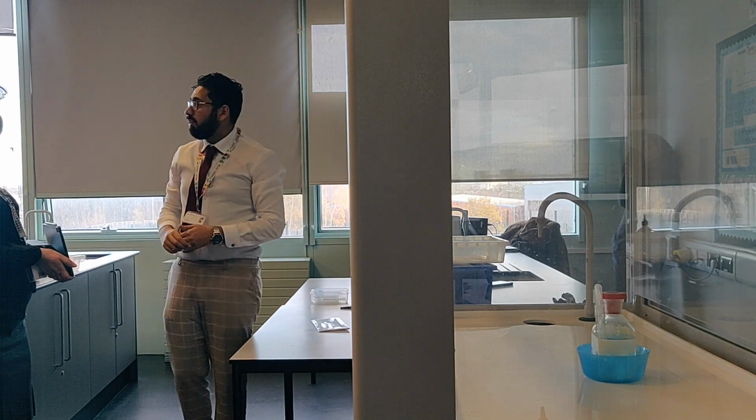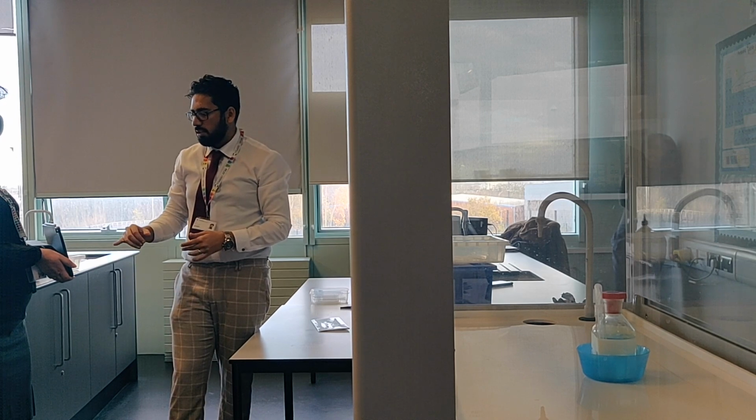Okay? So those were the tests for halide ions in an aqueous solution with both dilute and concentrated ammonia. Now, I don't know if we're going to have time for the last one. Let me just discuss it next and I'll come back.